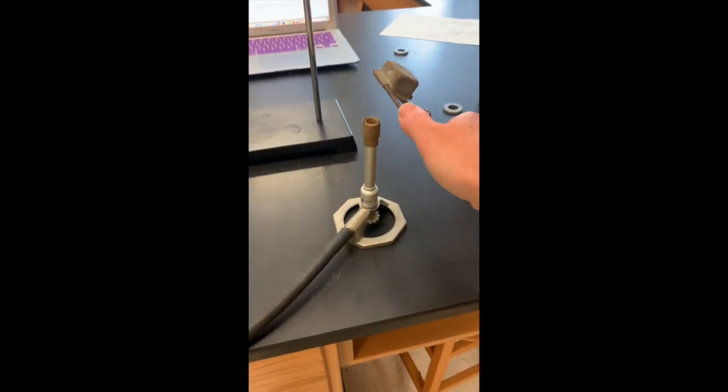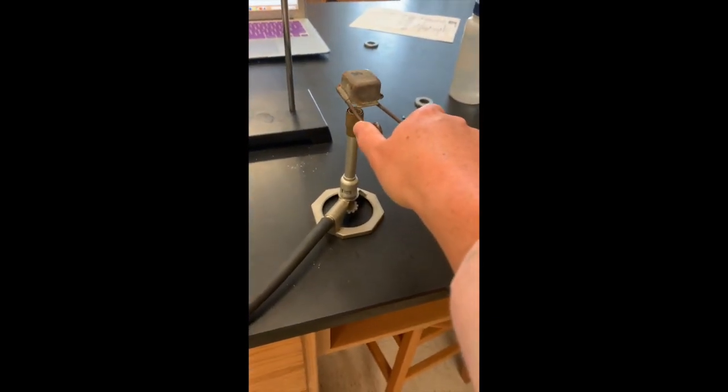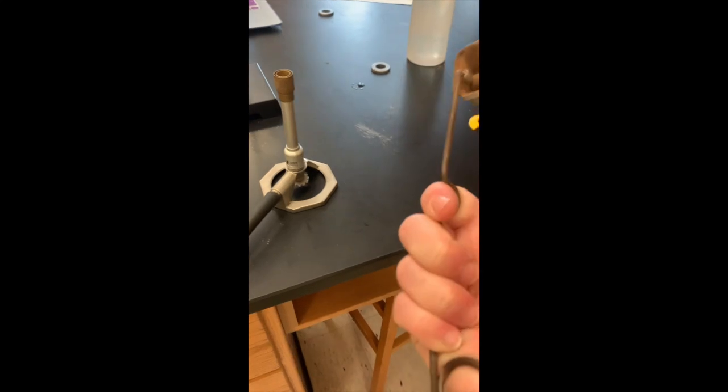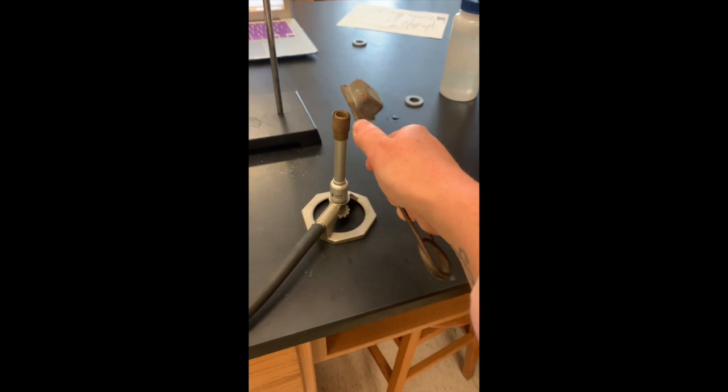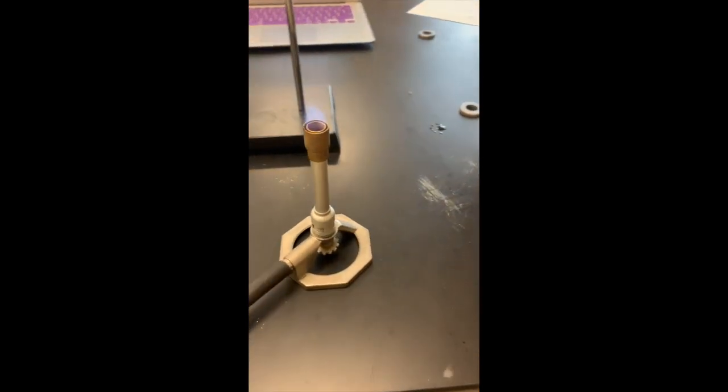Stand at arm's length away and don't cover the entire burner, but strike this at an angle. Sometimes you have to work a little bit harder to get that spark. And as you can tell, there's the flame.